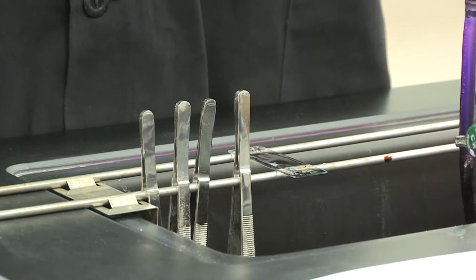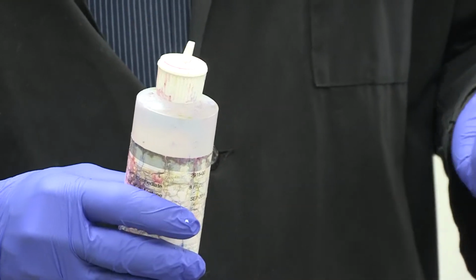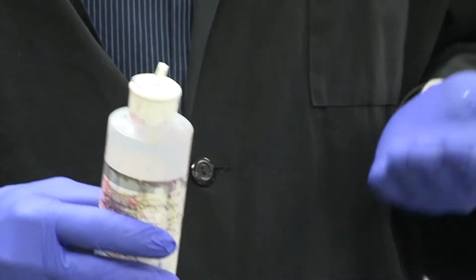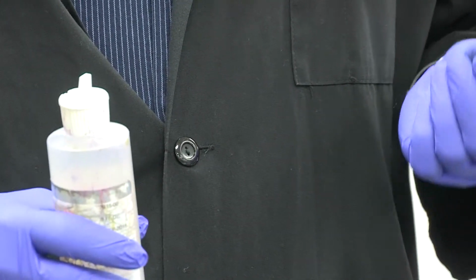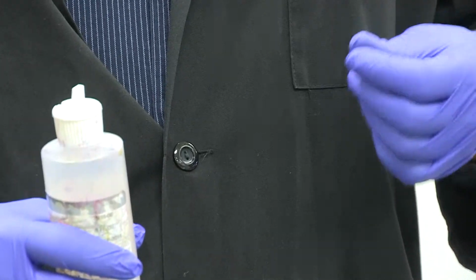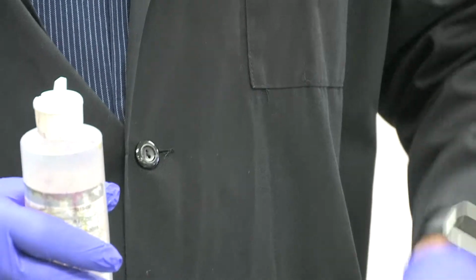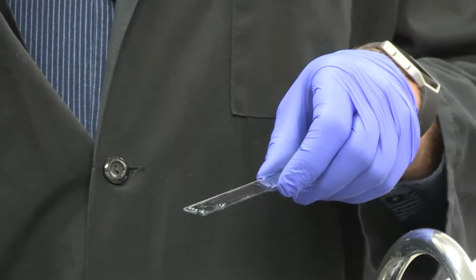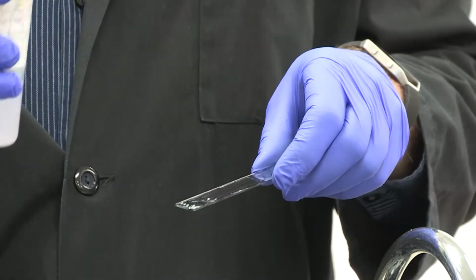Now, if you do this too long, however, it will start to make your gram-positives, which are supposed to be purple, look much lighter purple. And if you don't do it long enough, it makes your gram-negatives, which are supposed to be pink, look darker pink. And so that might be confusing. If you see a light purple or a dark pink, that might look like the same color and you won't be able to tell. So the maximum amount of time is 5 seconds with this. And that 5 seconds starts as soon as the first drop of this alcohol hits, and it stops as soon as you rinse it off.